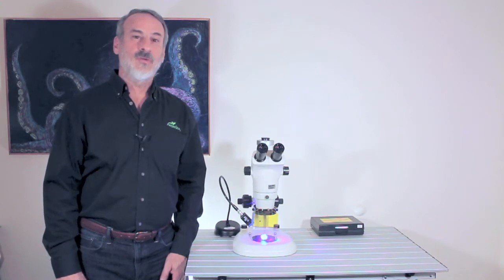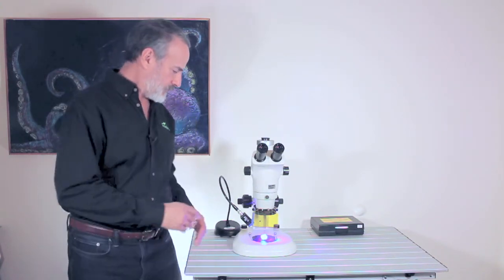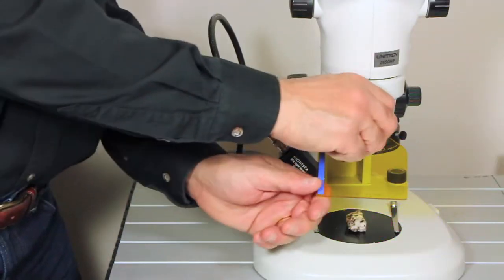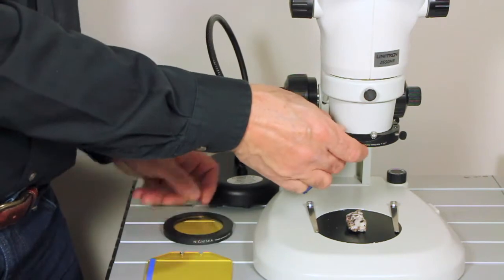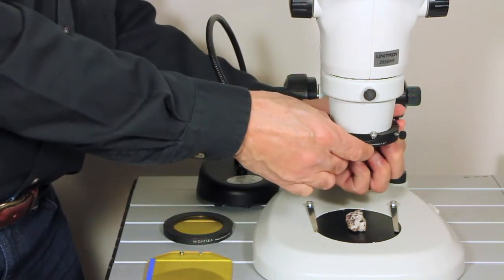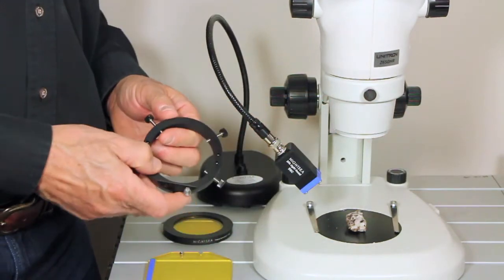First thing we're going to do is turn this microscope back into an ordinary stereo. And done, that's all there is to it.